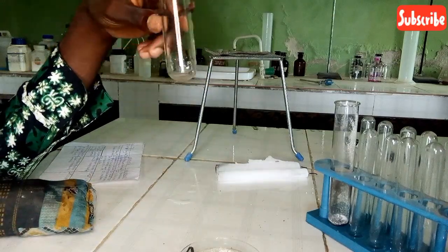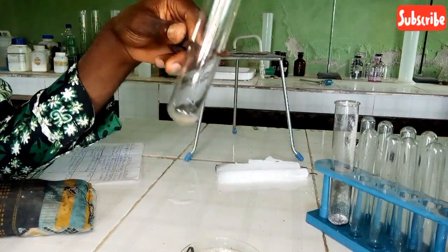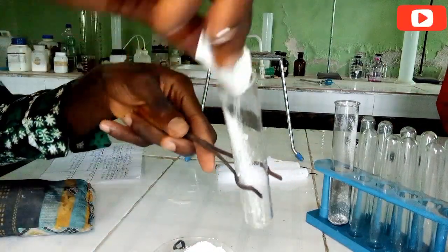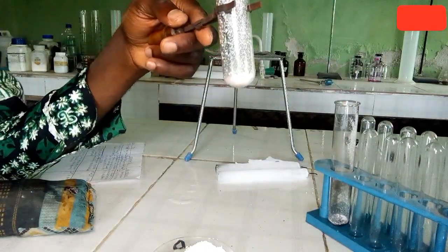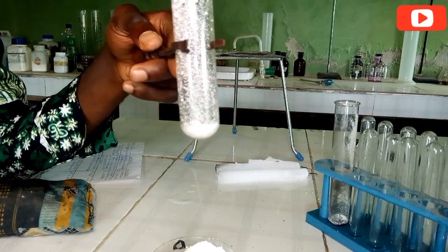Fill this with water. So this is sample D; I have not put the sample there yet. Adding it to the test tube, and then let's add a few cubic centimeters of HCl.